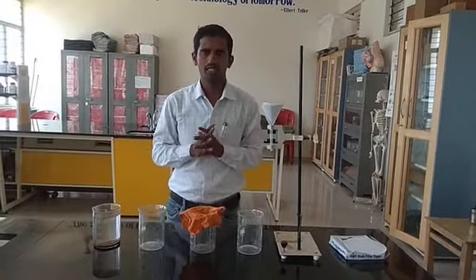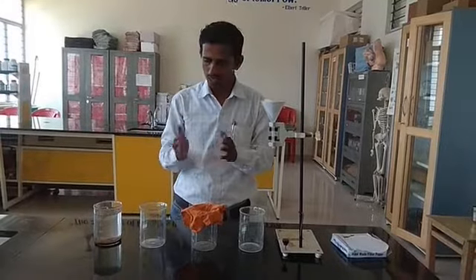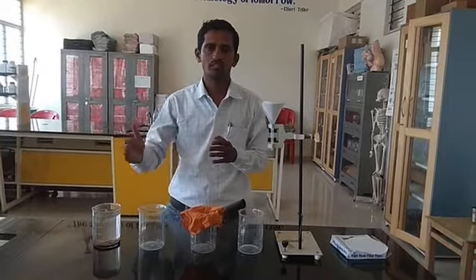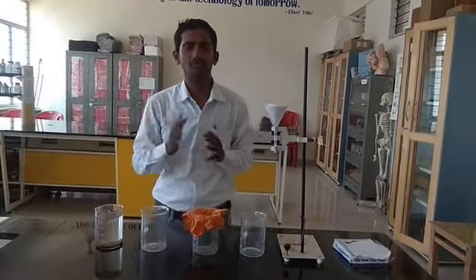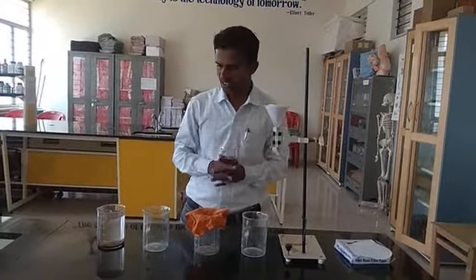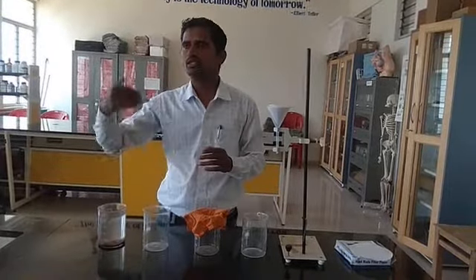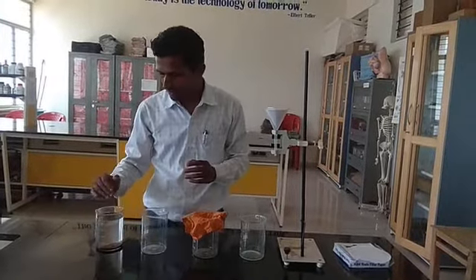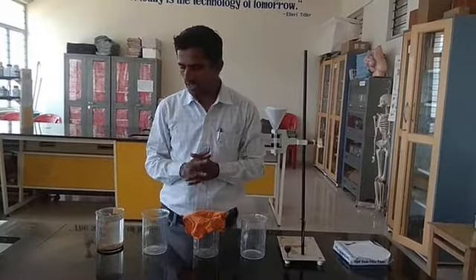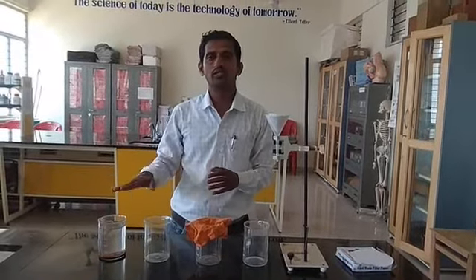How can we filter this water? What are the different methods we can use to separate the insoluble impurities from muddy water to get pure water? Here I have taken a beaker and added a maximum amount of water along with some soil particles so it becomes muddy water. You have to keep it for a minimum of 20 minutes to half an hour. I kept it for half an hour because it takes time to settle.